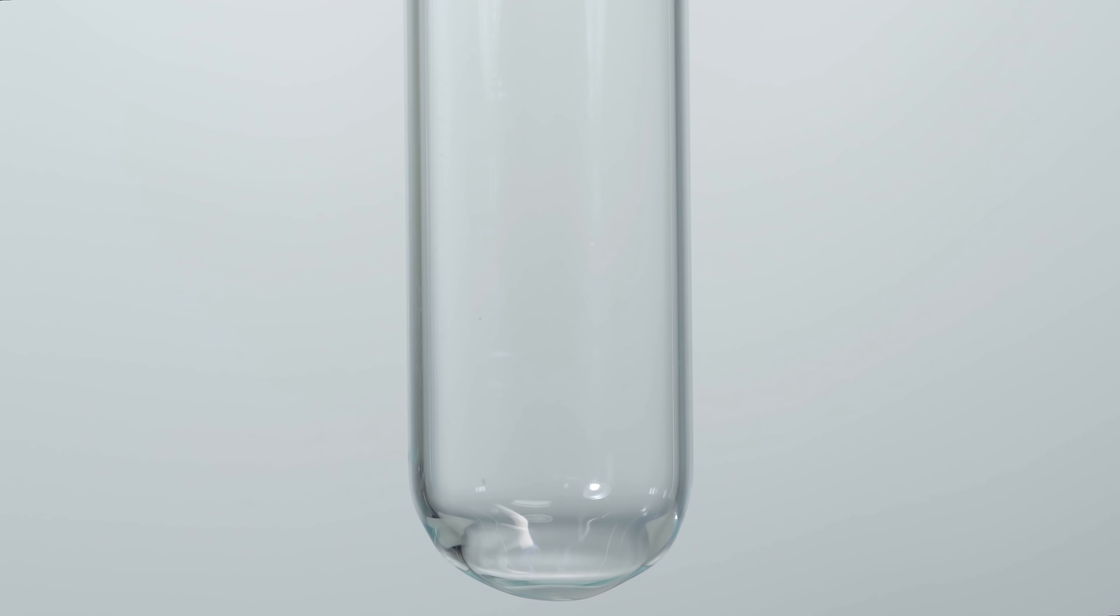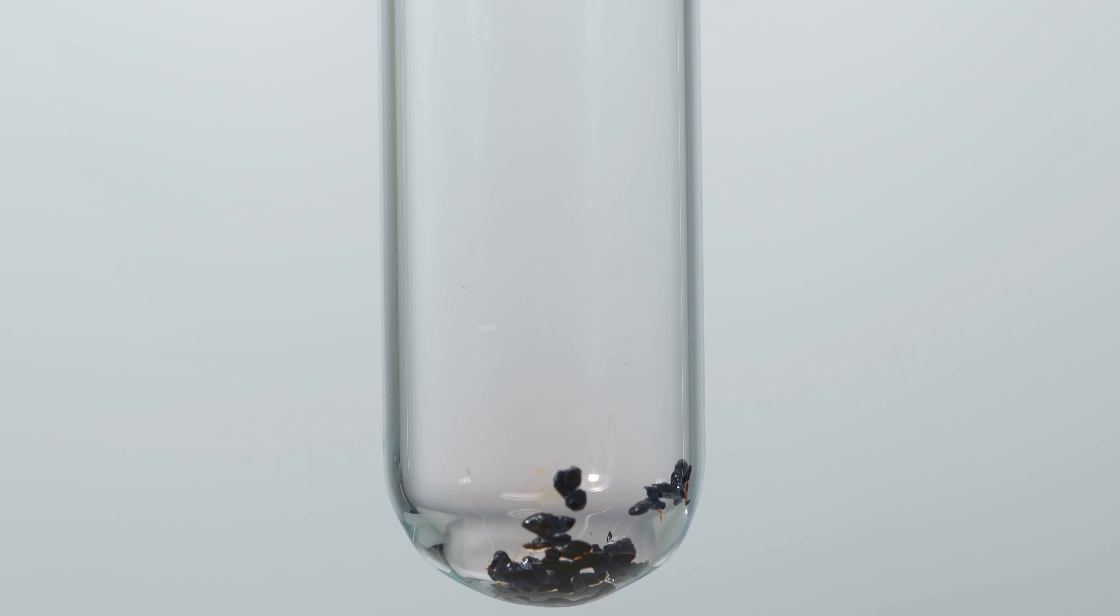This is how iodine monobromide crystals look at a very close range. At melting point, iodine monobromide changes into a red-brown liquid with a strong smell of bromine.